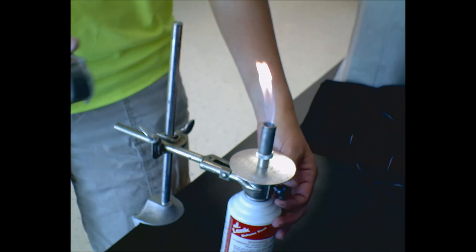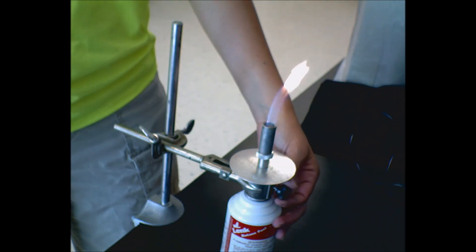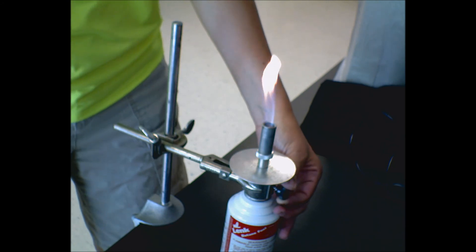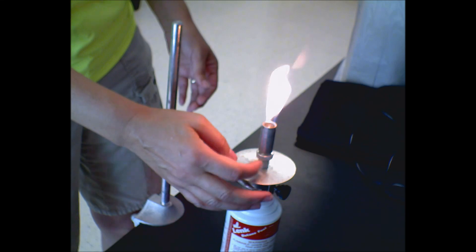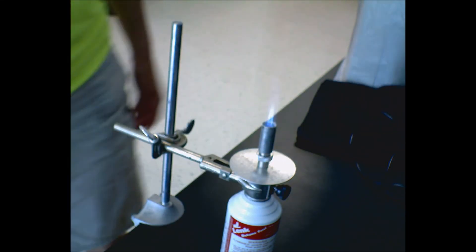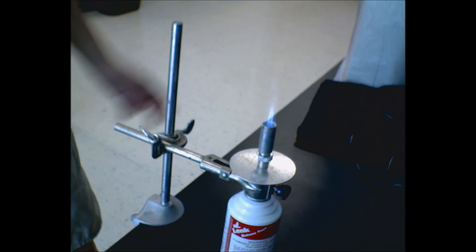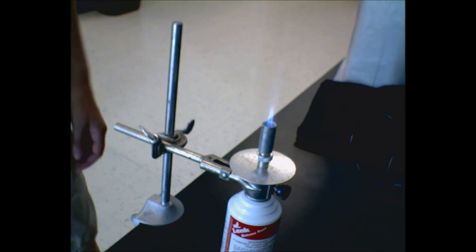Too much air with the striker, it doesn't light. So now I adjust my flame, and now I'm back to my happy blue flame for melting glass or whatever it is we need to use, catch magnesium on fire or whatever.